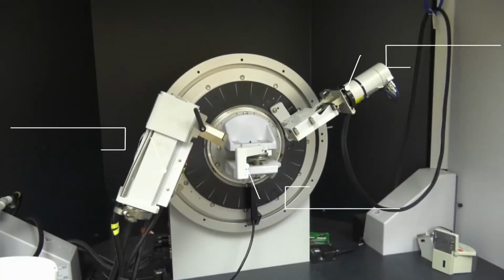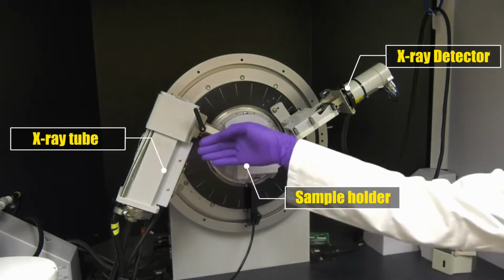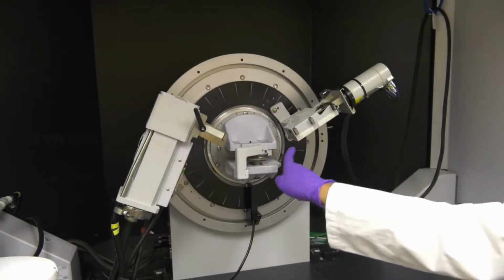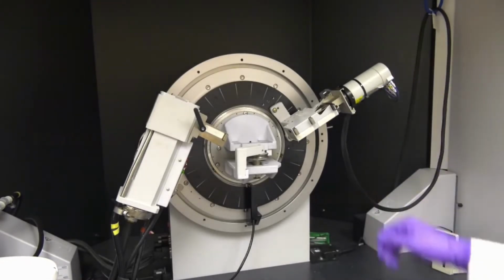X-rays are generated by accelerating electrons into a copper target. X-rays are directed towards the sample where they diffract. Angles of constructive interference will diffract X-rays into the one-dimensional detector, which transduces the X-ray intensity.